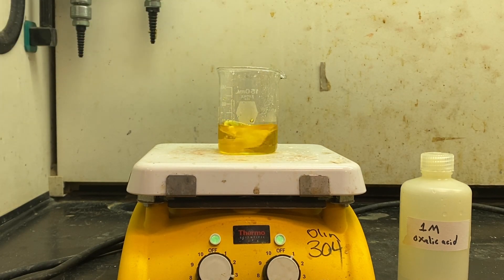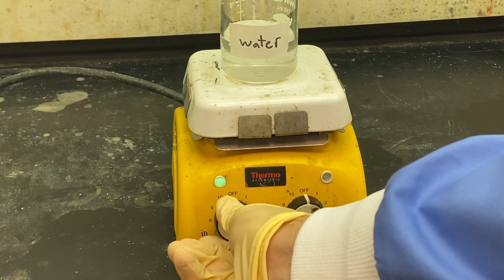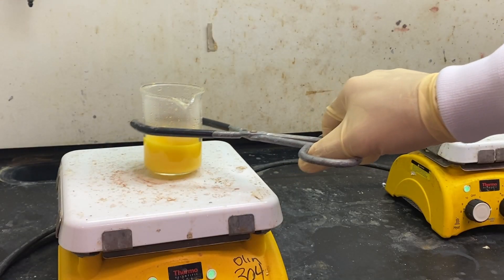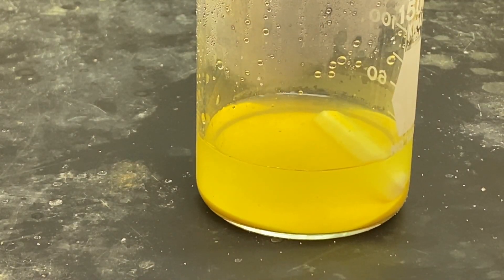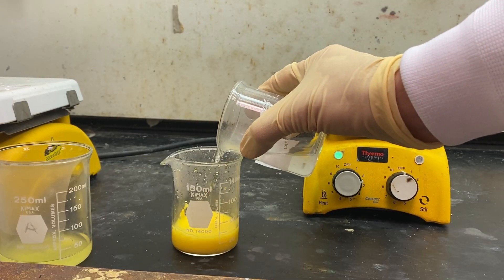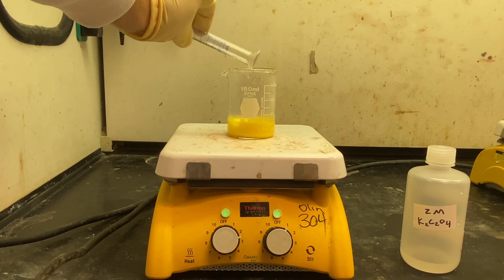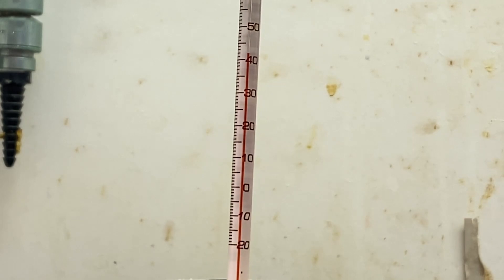While this heats to 75 degrees Celsius, another beaker of just water is placed on a hot plate to warm. Once the reaction reaches 75 degrees, it is removed from the hot plate with tongs and the precipitated solid is allowed to settle. The supernatant liquid is decanted off and the remaining solid is washed with the clean water from the warm beaker and again decanted. Then 10.5 milliliters of 2-molar potassium oxalate are added and the solution is heated to 40 degrees Celsius.